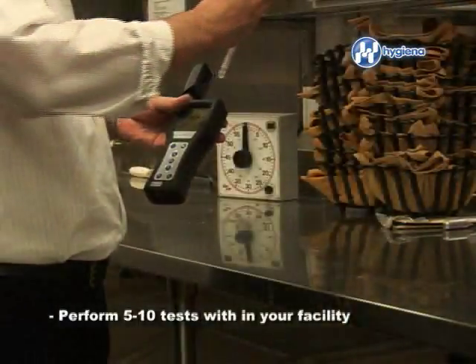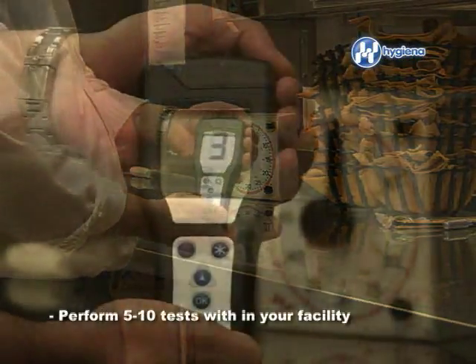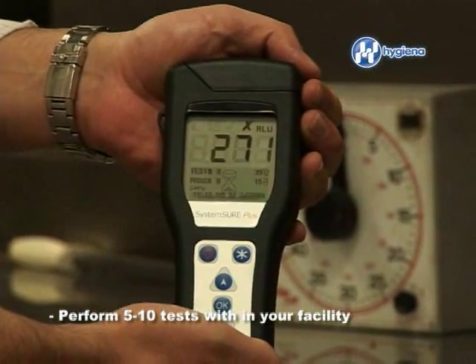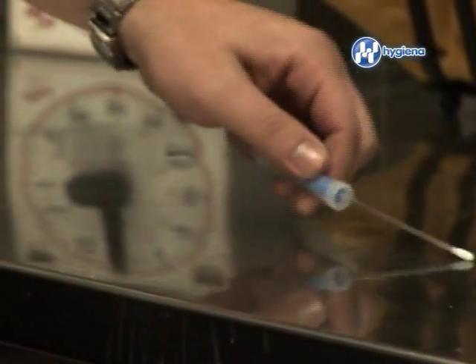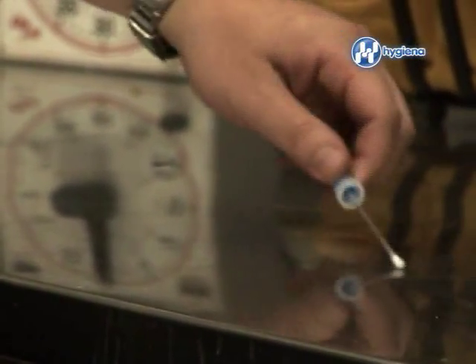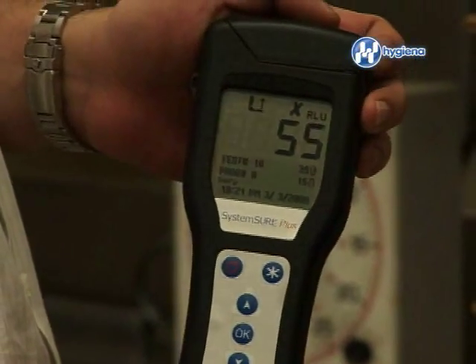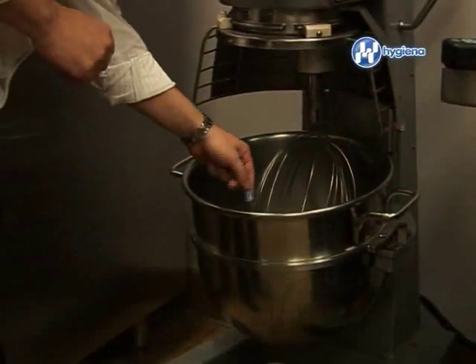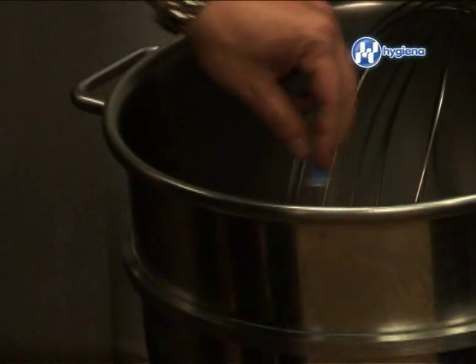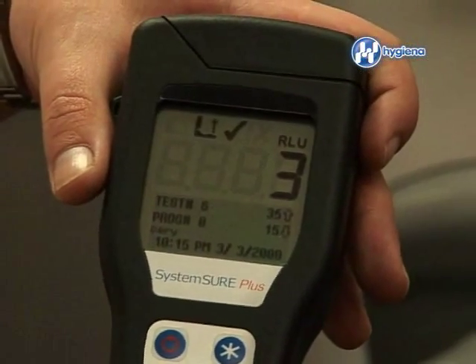To create a threshold range, perform 5-10 sample tests of the same area of the work environment. Repeat these steps in different areas throughout your facility to create multiple threshold ranges, but make sure to do so after each area has been thoroughly cleaned. Make sure to write down the results for each test.